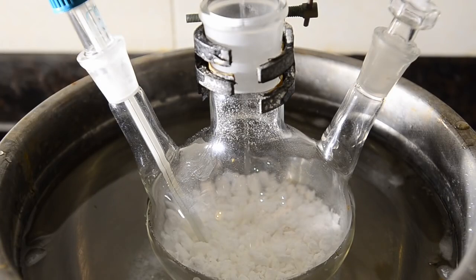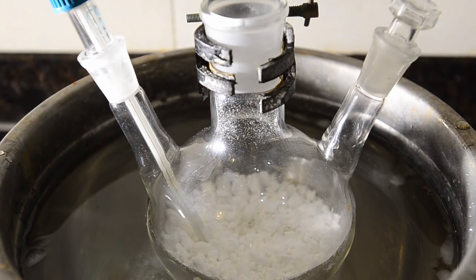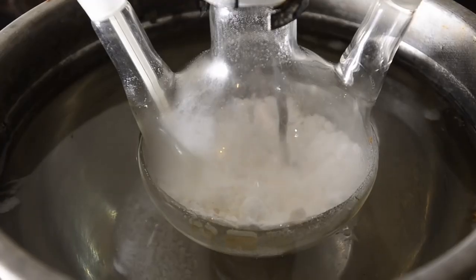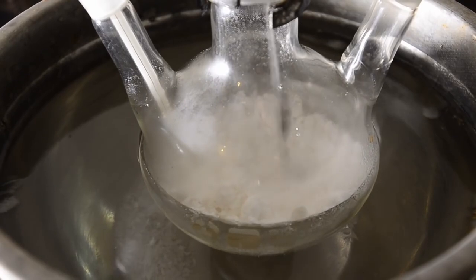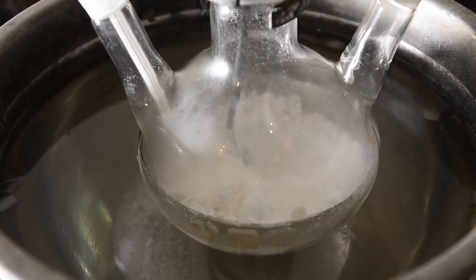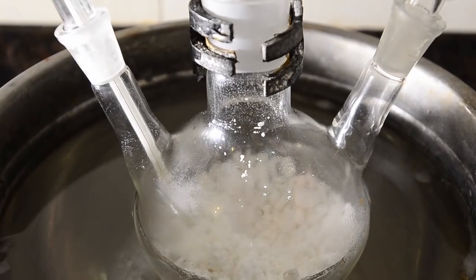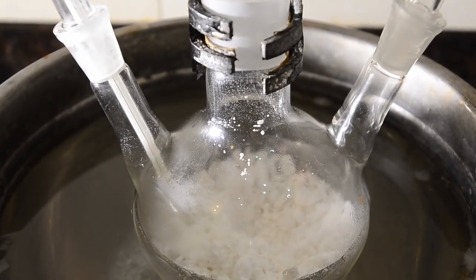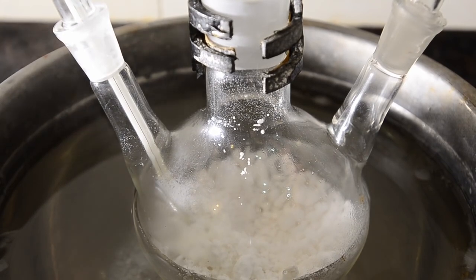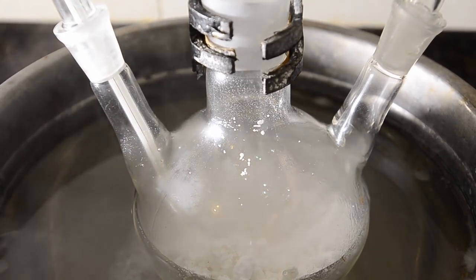Now slowly add a small amount of the chilled acetyl chloride to the sodium acetate in the ice bath. Give the mixture a stir and allow the acetyl chloride to absorb and react. This produces quite a lot of heat so go slowly, and don't allow the temperature to rise above about 60 degrees C otherwise you'll risk losing acetyl chloride.